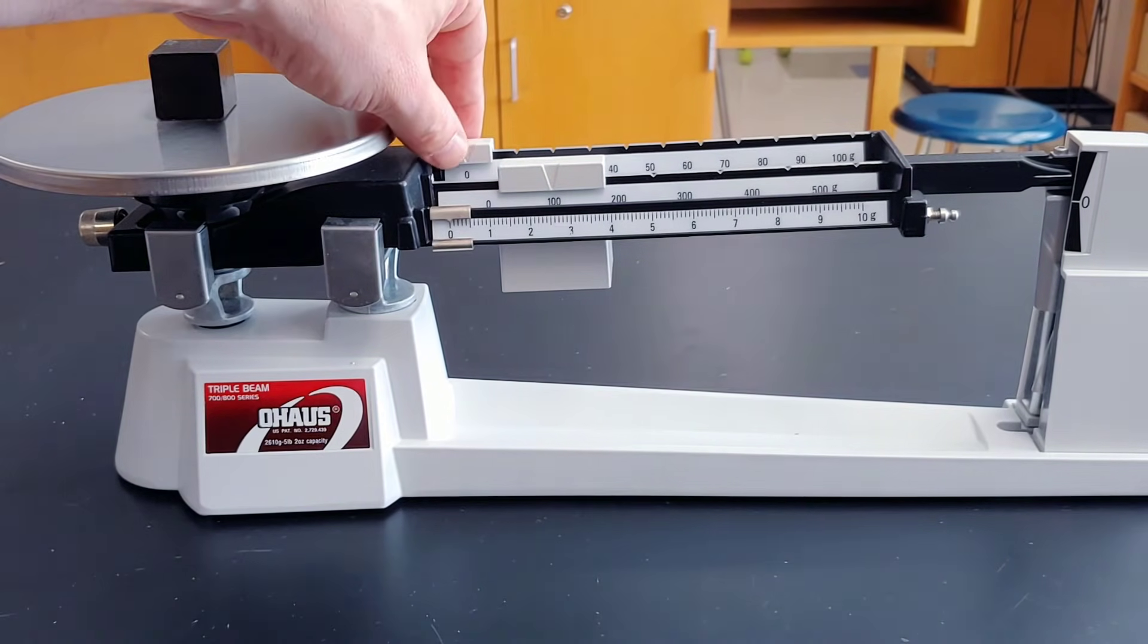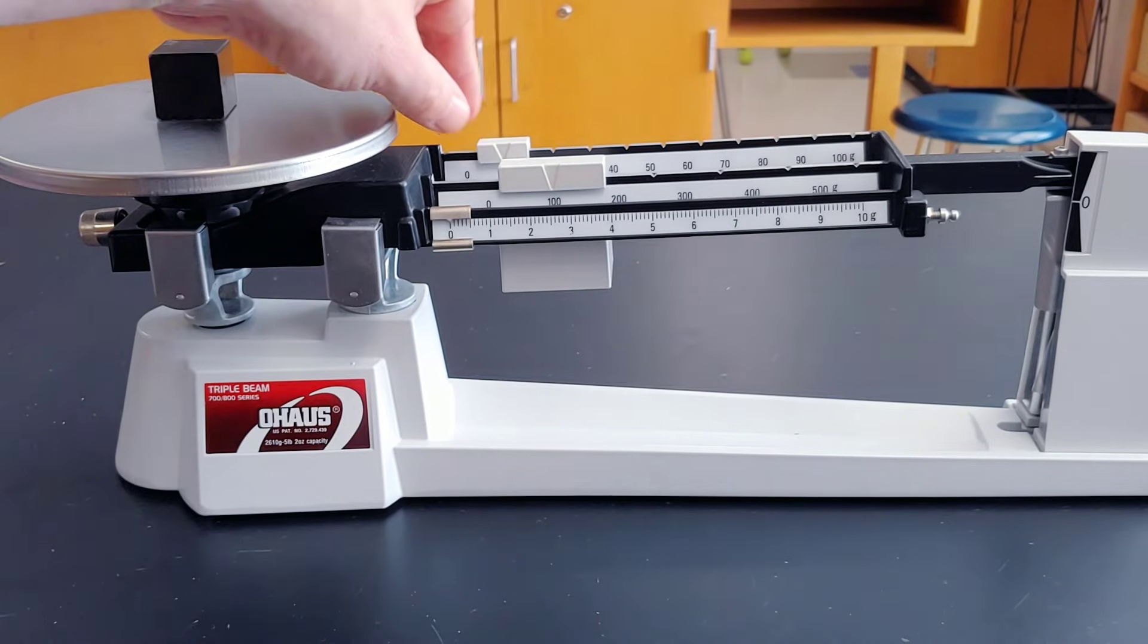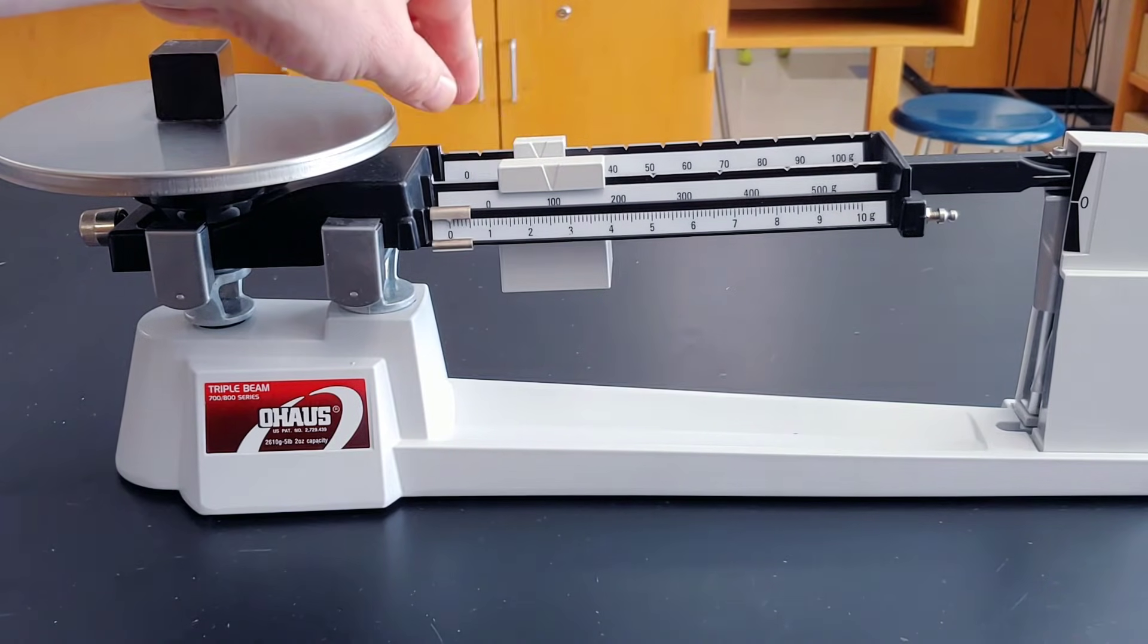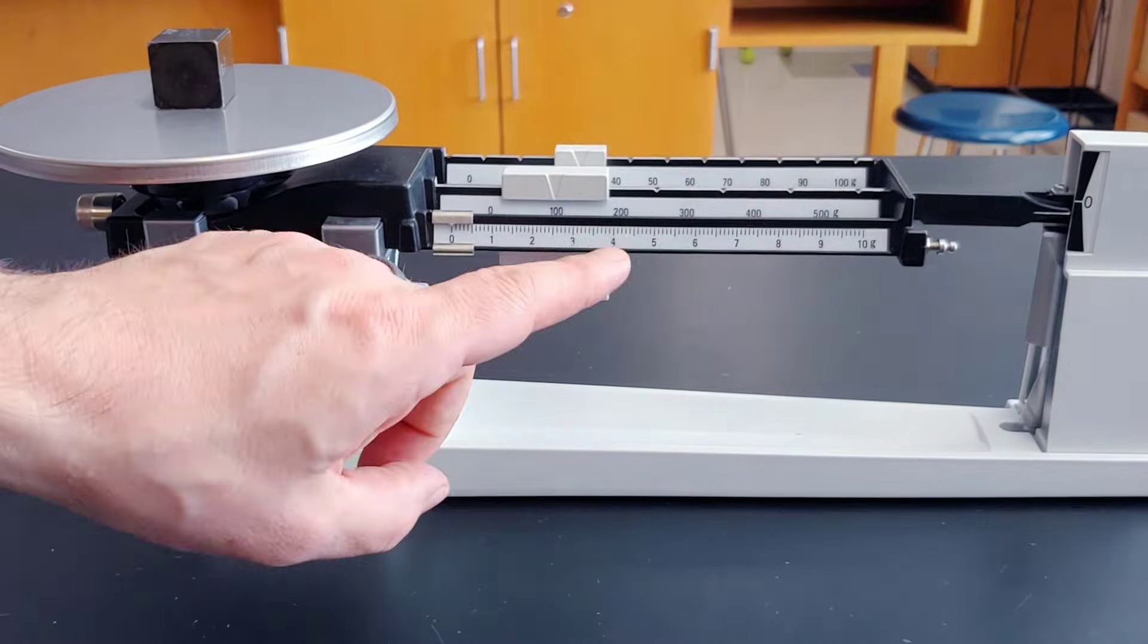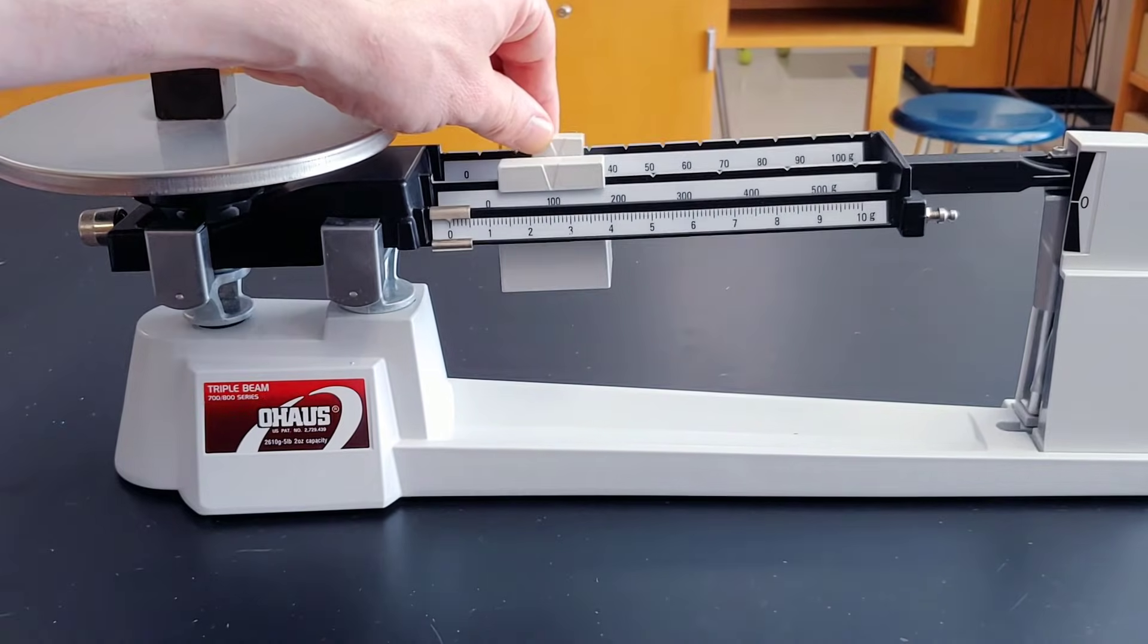Now the next heaviest. Move it across into that notch. Move it across. Let it rest in the notch. Move it across. It went down. We're going to move it back.